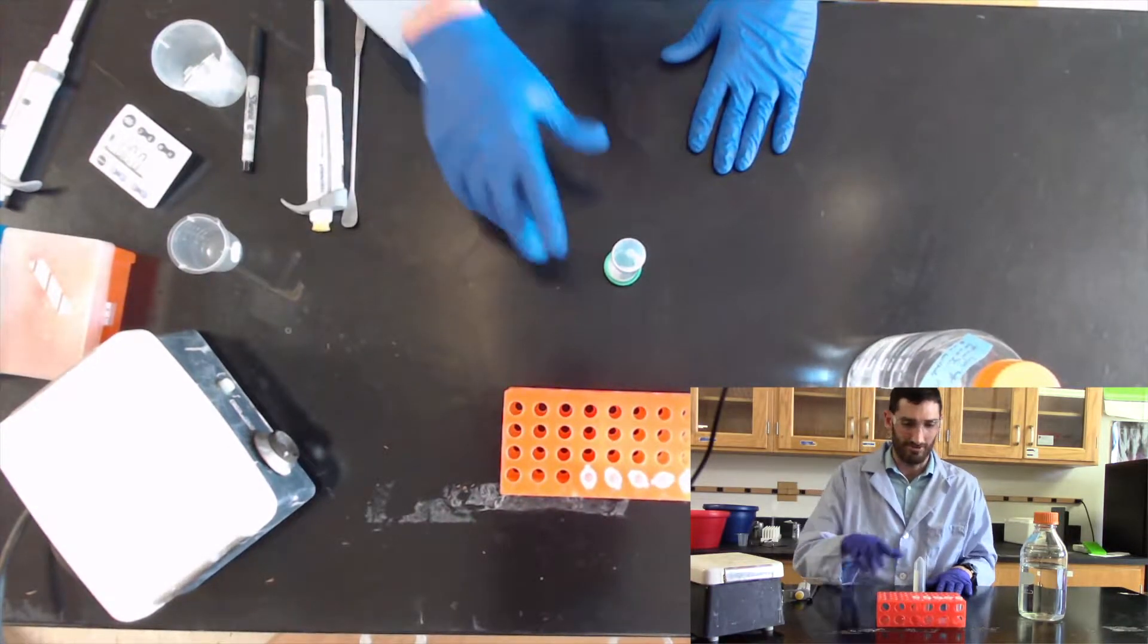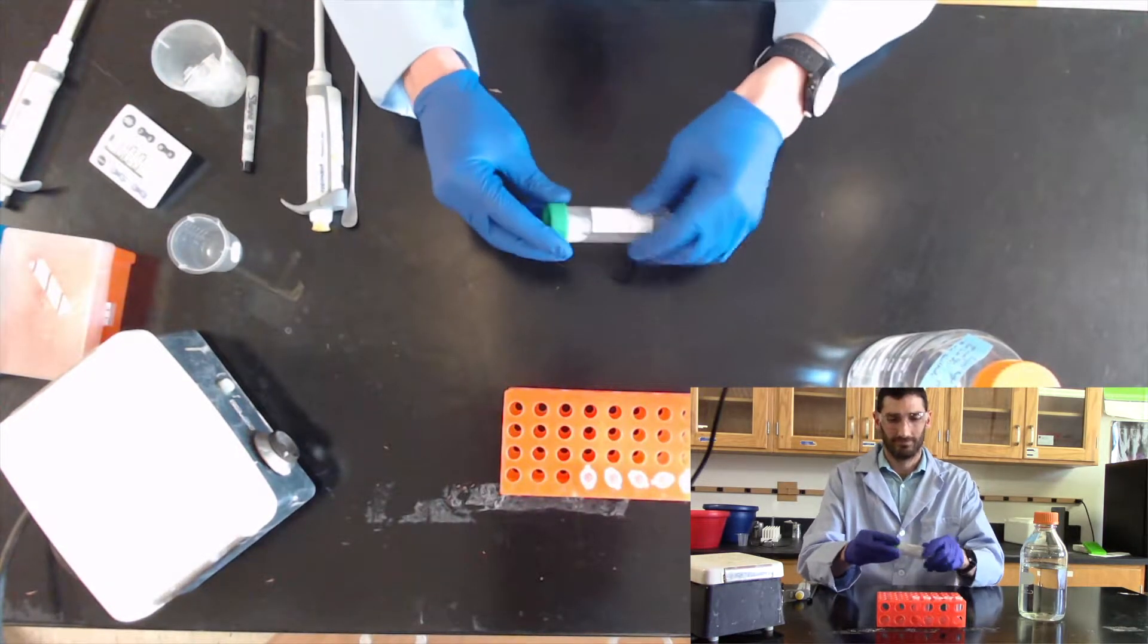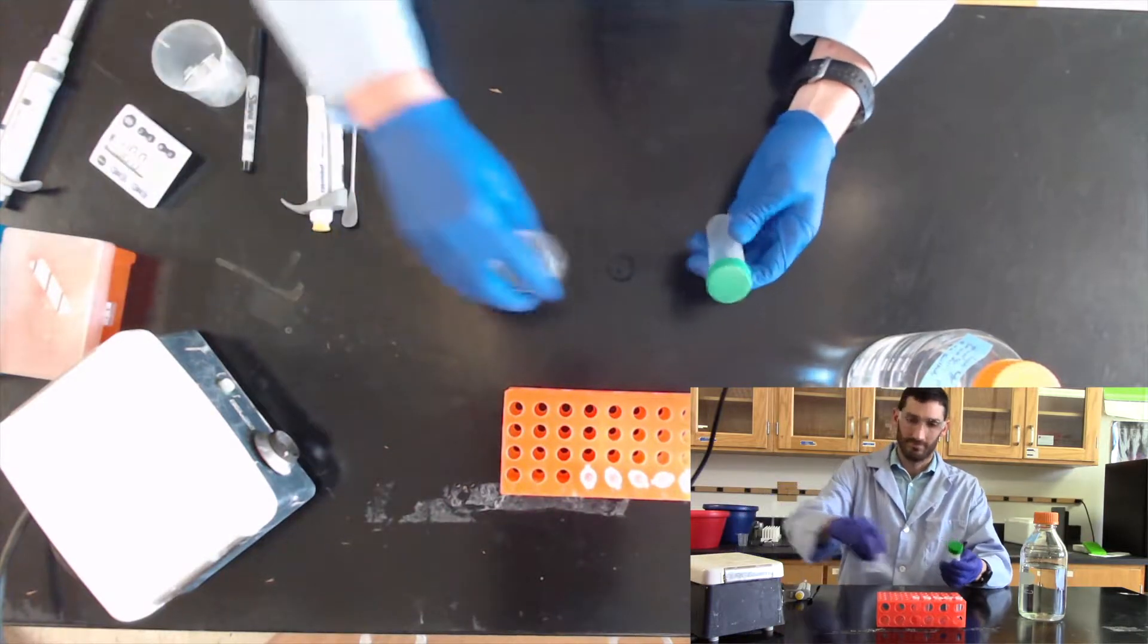As a reminder, collect 25 microliter samples at indicated steps of the purification to analyze by SDS page.